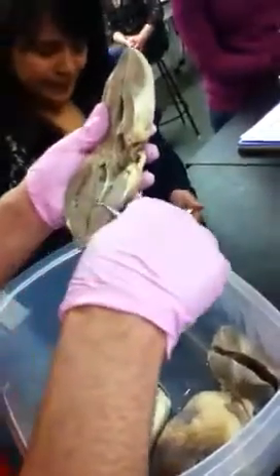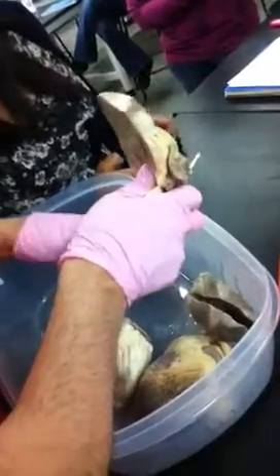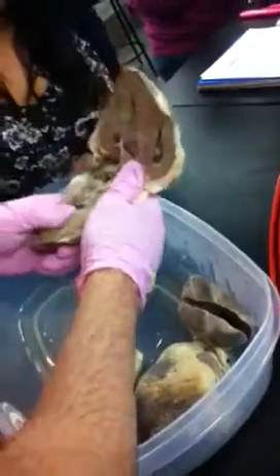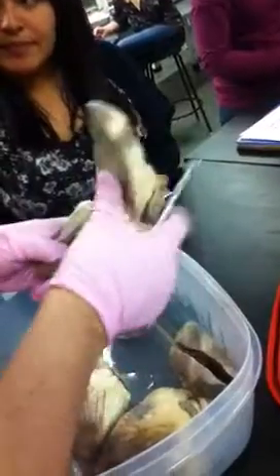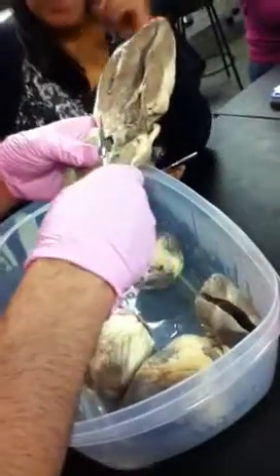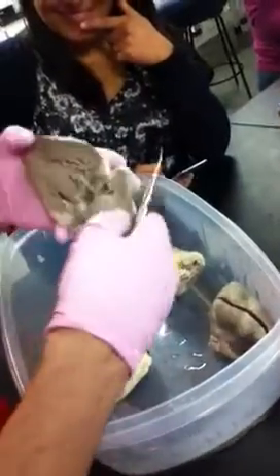Yeah, so papillary muscles we didn't really see. They would be these little muscles down here at the bottom. So what the chordae tendineae is attaching to would be a papillary muscle. Okay, at the bottom. Yeah. Would that be more like a picture? It's probably more like, I wouldn't worry about it. It would be more like a picture or whatever. Or you're not going to see it. One of the two.